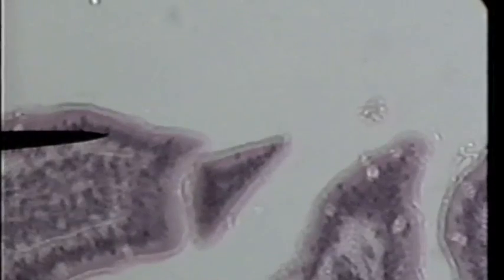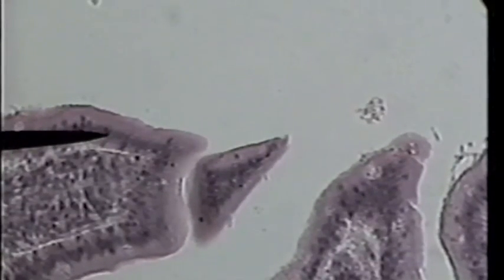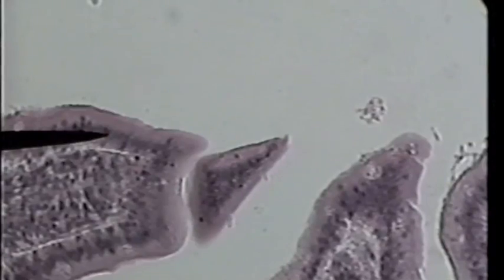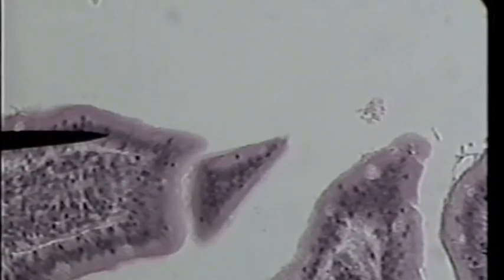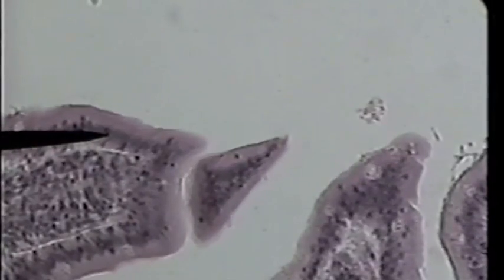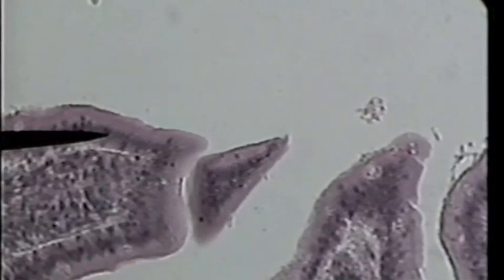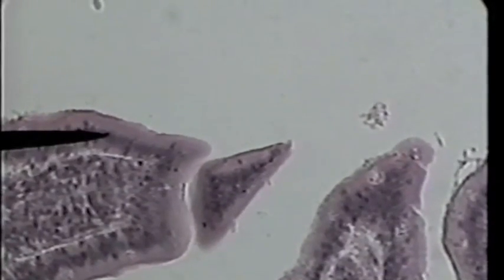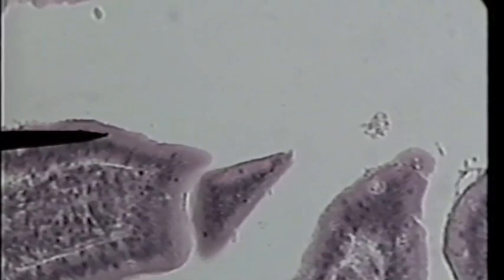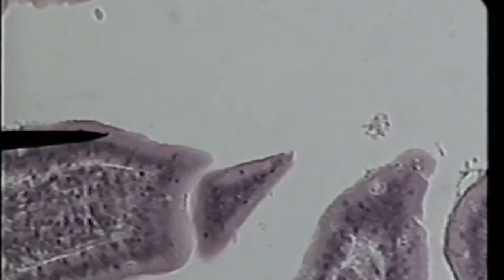Now we'll go to high power. The tip of the pointer is on simple columnar epithelium. At the very tip of the pointer we can see a dark layer — those are the nuclei of the columnar cells. The nuclei are found in the basal region and the cytoplasm is found in the apical region of the cells, giving this pink layer.